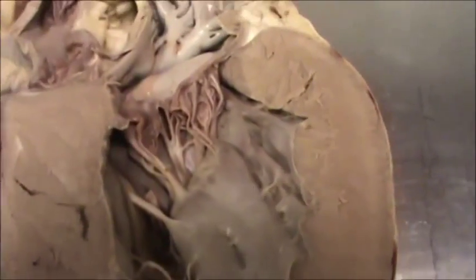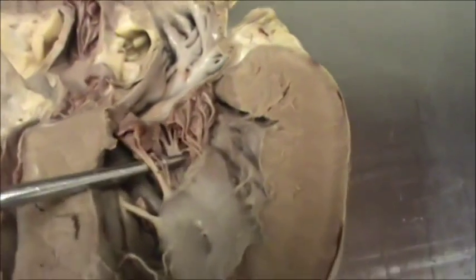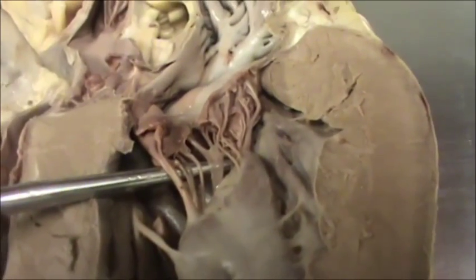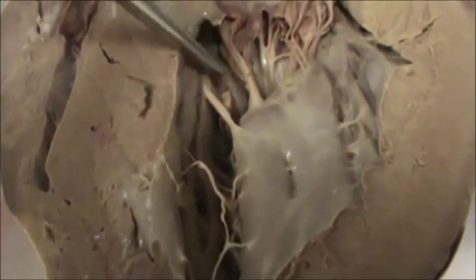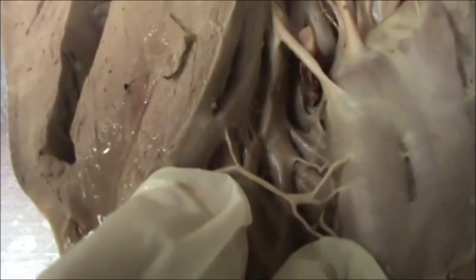The bicuspid and tricuspid valves attach to muscular projections called papillary muscles through chord-like structures. These chords are called chordae tendineae. The inner ridges and folds in the ventricles are called trabeculae carneae.